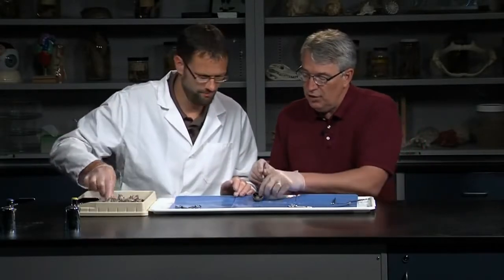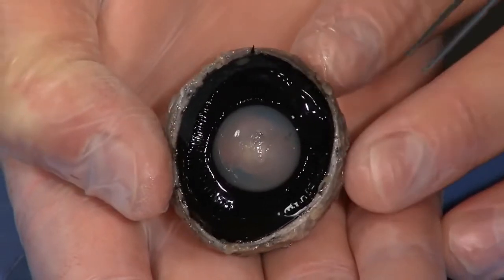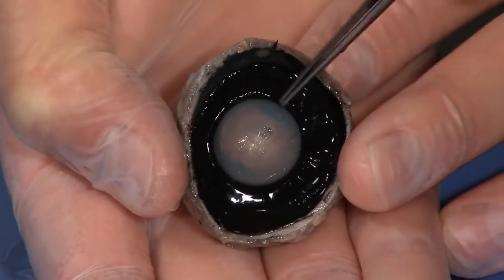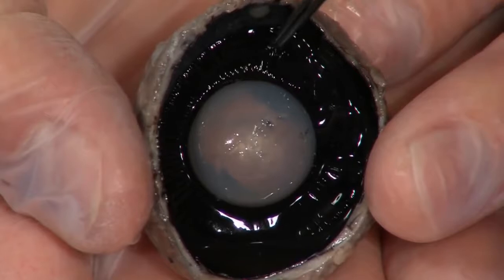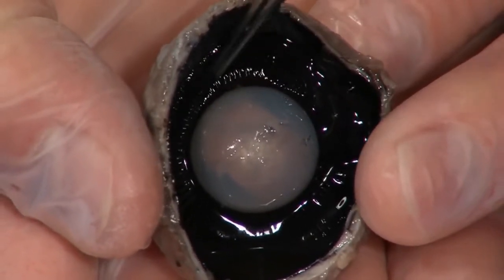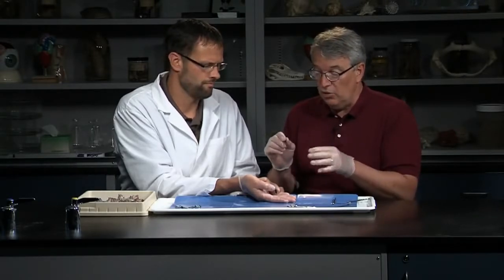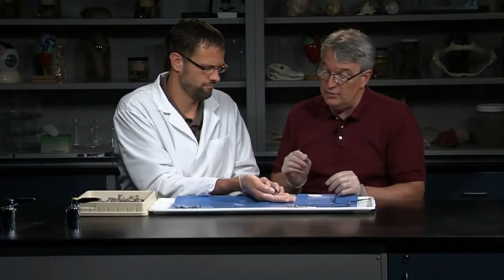If we go to the front part of the eye, right away you notice this big spherical thing sitting in the middle — that's the lens. The lens focuses the light on the retina. It's almost plastic-looking; it's layers of membranes, but it is living tissue. It's attached to the ciliary processes — these striations here. Those muscles in the ciliary process can change the shape of the lens. In life, the lens is a much more flexible structure, and the muscles can pull and change its shape, allowing your eye to accommodate for near and far things and change the focus.